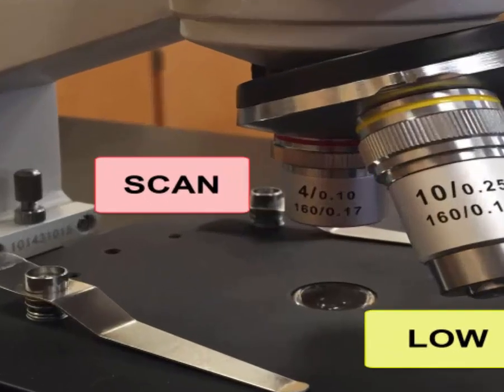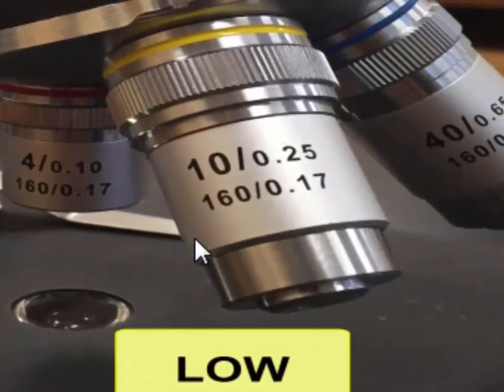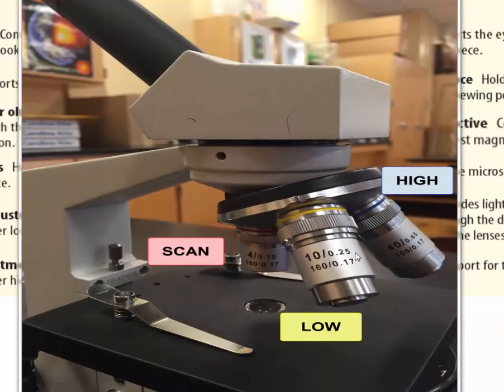Now we name these the scanning lens, the low power lens, and then the high power. We call this the scanning lens because we use this to scan for objects. We call the yellow lens a low power lens because New York State refers to this as a low power. And then we have the blue lens which we call the high power which has the highest magnification.